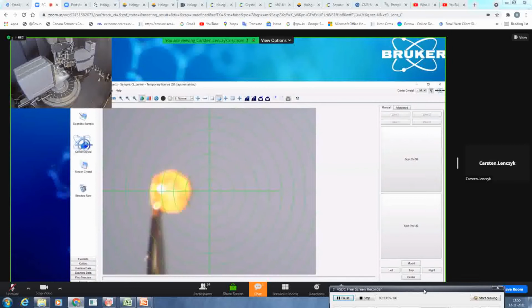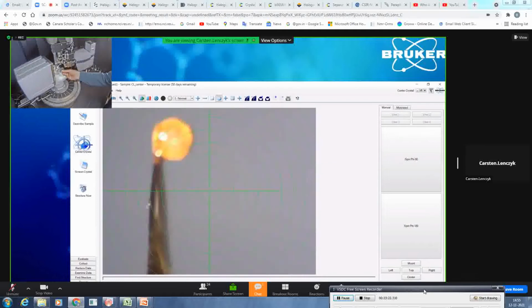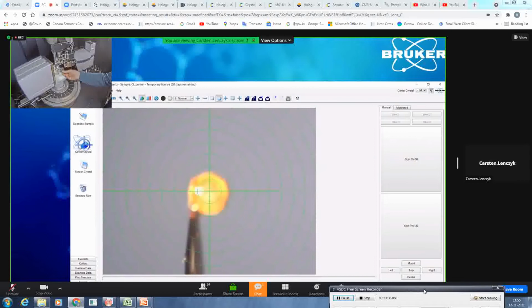If we have the manual goniometer head, you, as said, need a certain tool, which is this. As you can see, it is some kind of screwdriver, which fits perfectly into those screws on this goniometer head. What I will do now is adjust the height on the upper screw to get it aligned, as you can see here. Then I do the same for the left and right. I first put it into the center, which looks mostly okay. And what I would then do is click on 90 degrees.